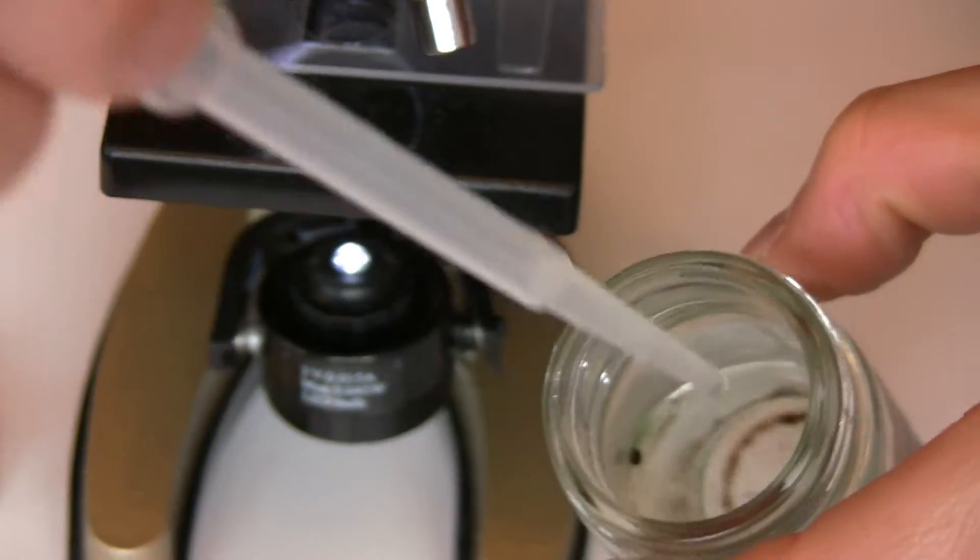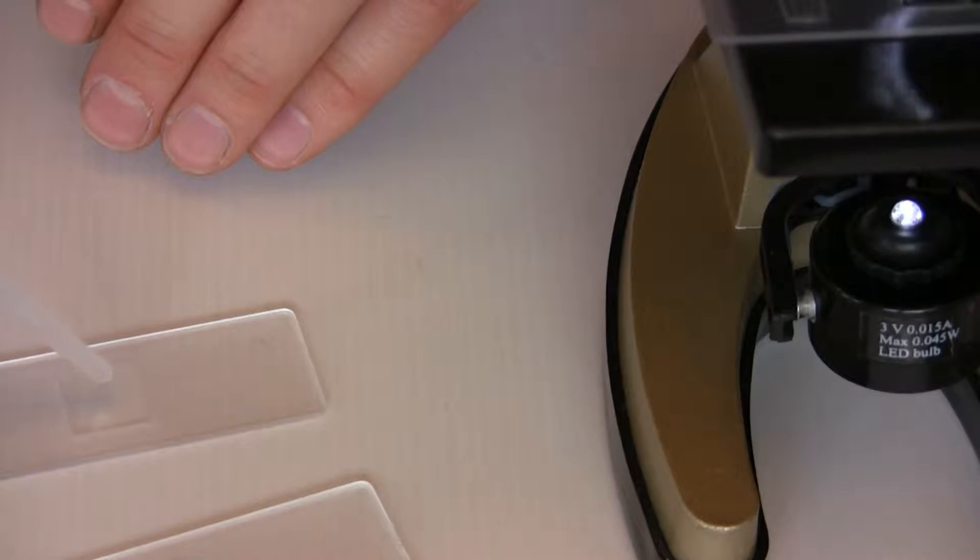So, use a pipette to take some sample and just drop it, a drop on each slide.